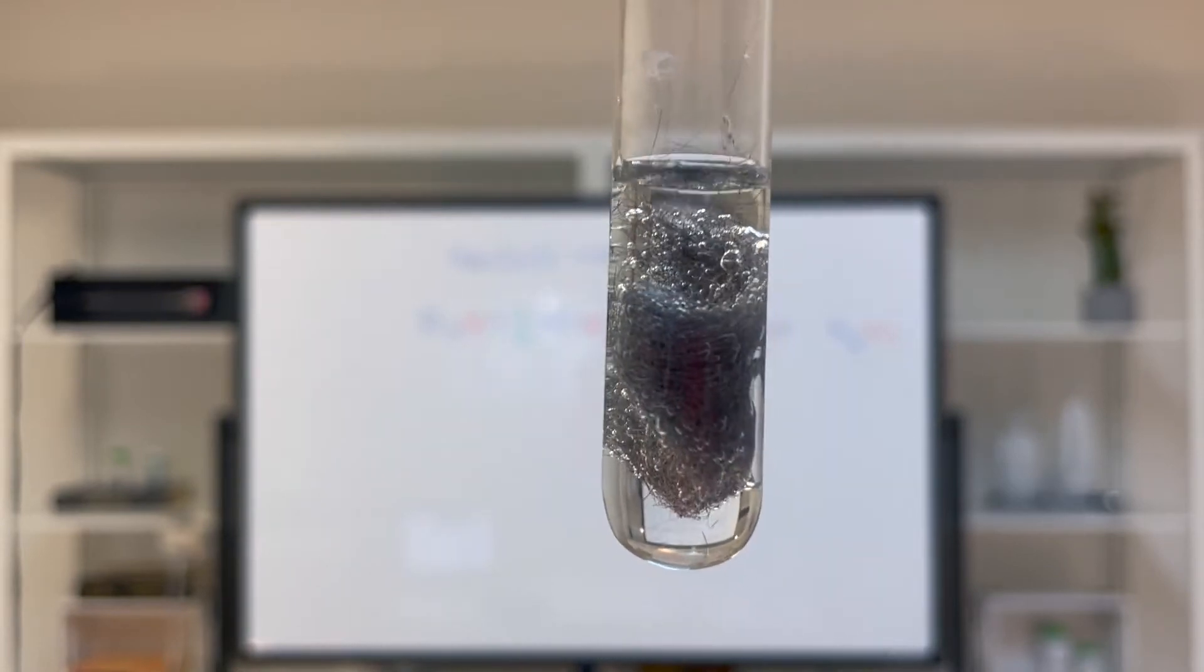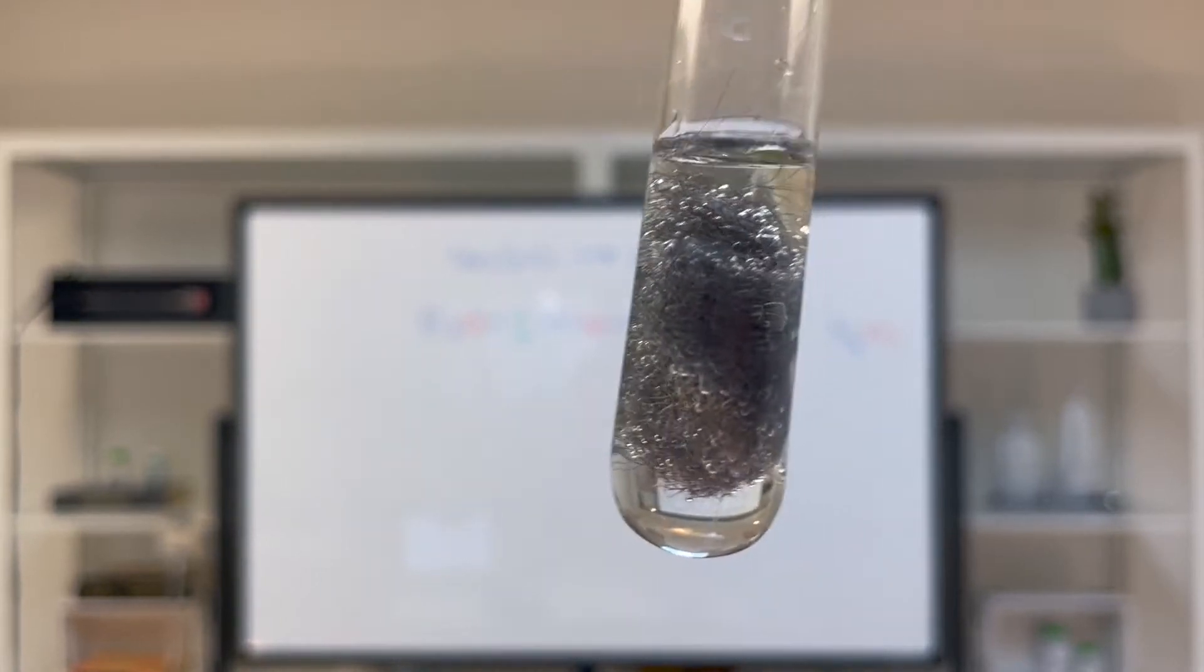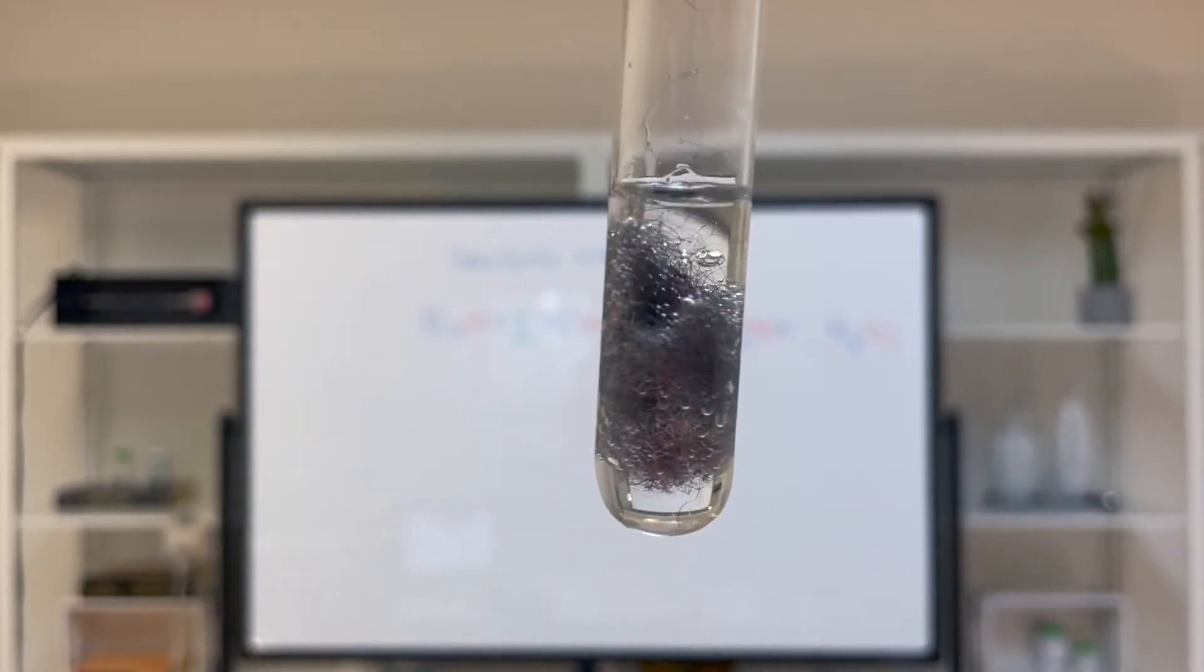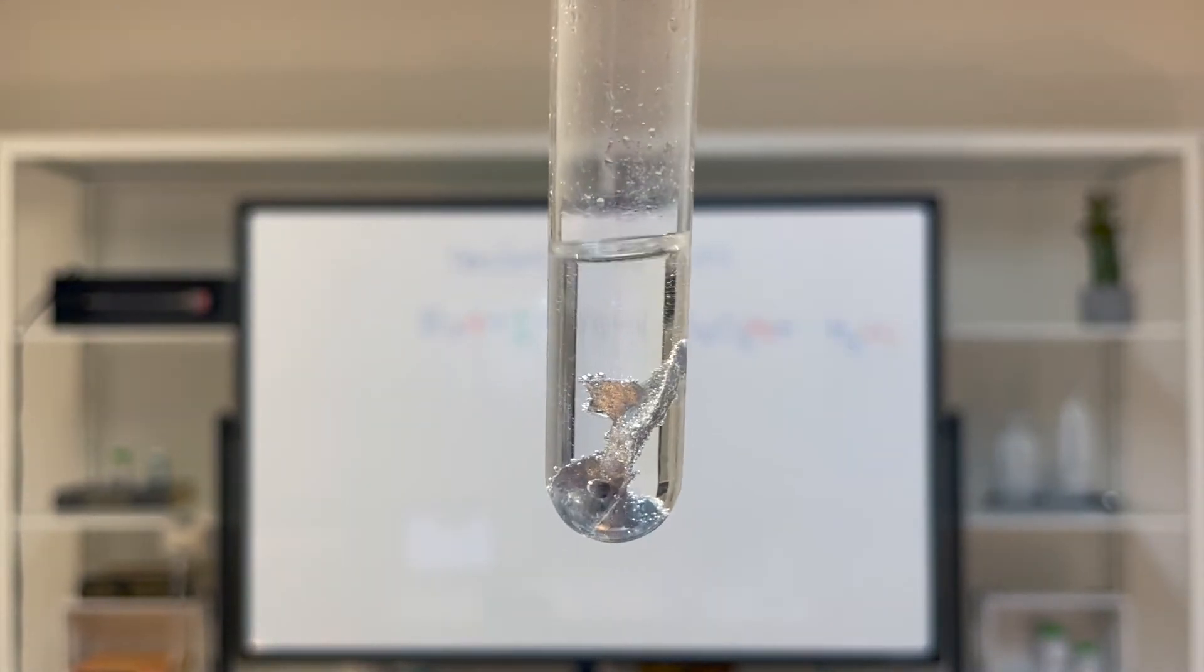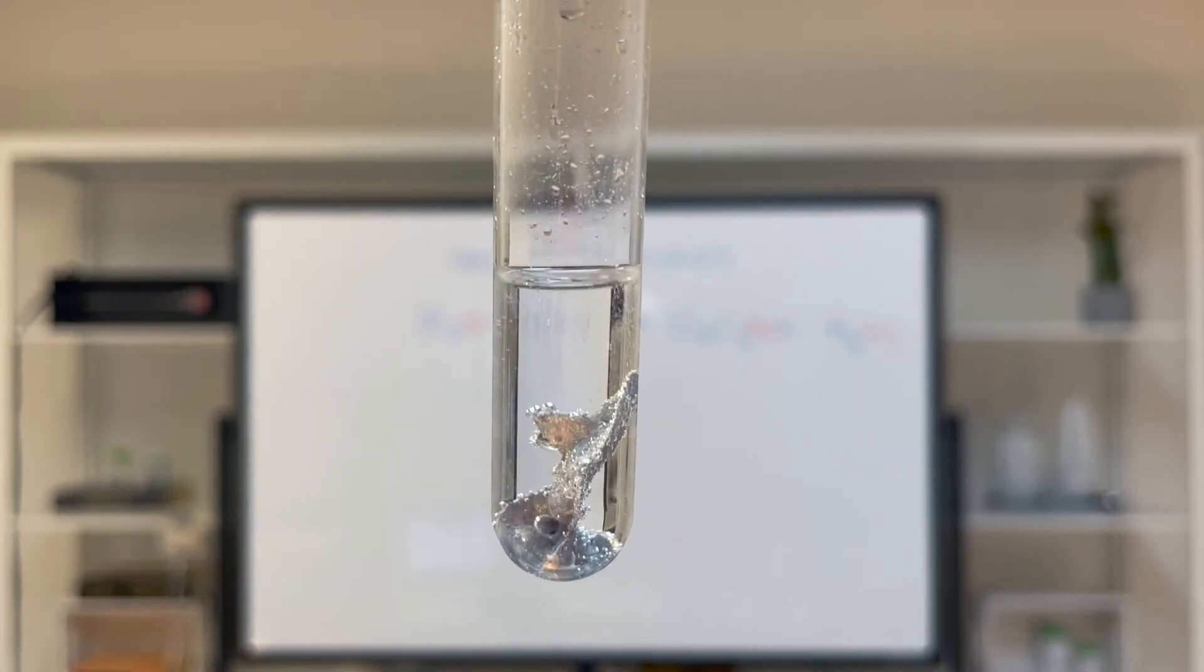Here is the iron immersed in hydrochloric acid, and I'm observing some bubbles forming all over the iron. Here is zinc in hydrochloric acid, and you can see the bubbles rise up to the surface of the liquid and go into the air.